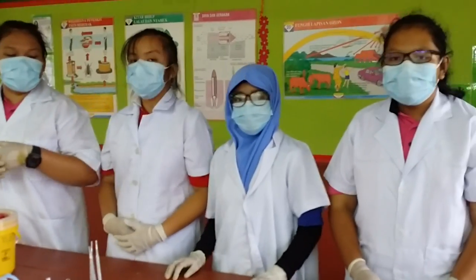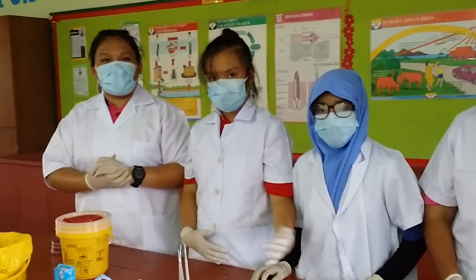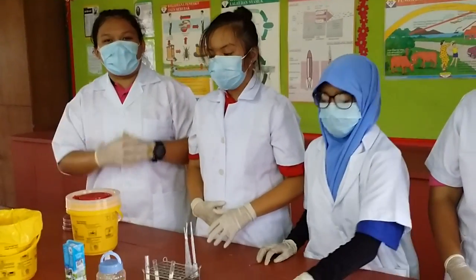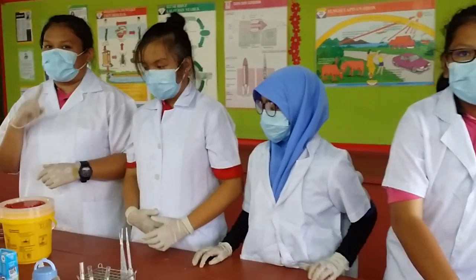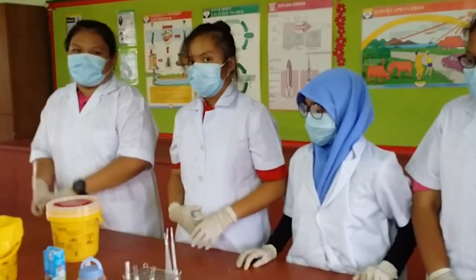Now, you just need to put all of this at room temperature and wait for a day to see the result. Actually, we have done this experiment a day before. And this is the result — ta-da!